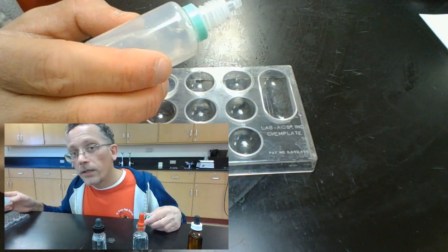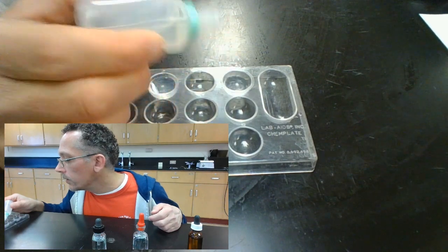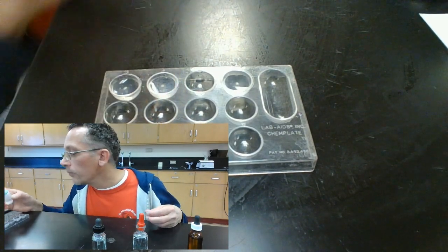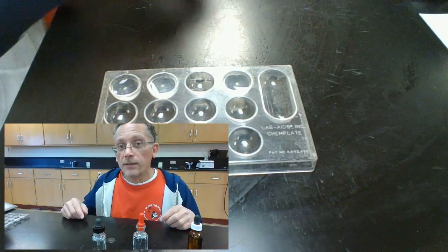And already I'm thinking it looks more like the calcium. The zinc produced more precipitate, it seemed like. So continue adding. And we've got a little precipitate in there, but it has not gone away. So I'm thinking that that unknown is the calcium. It's the calcium compound.